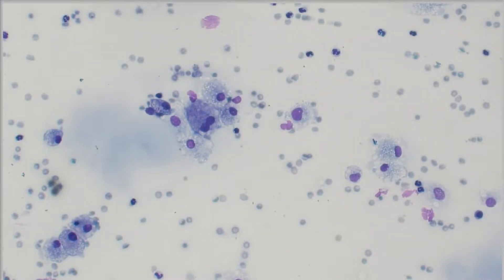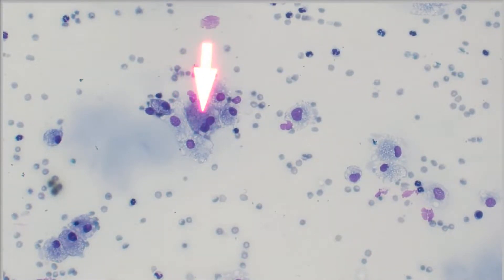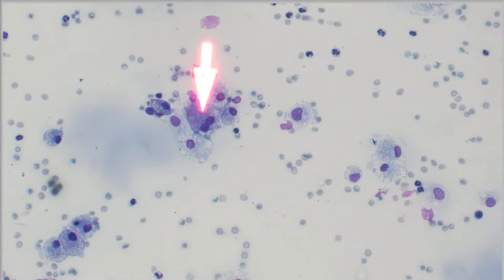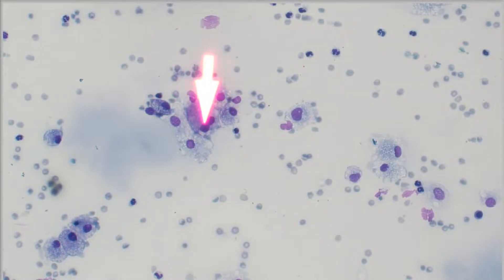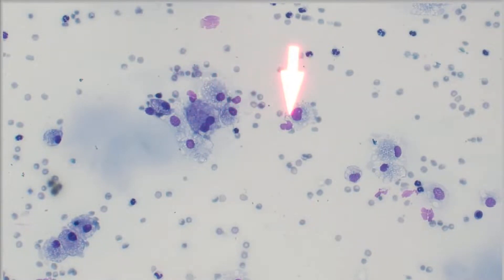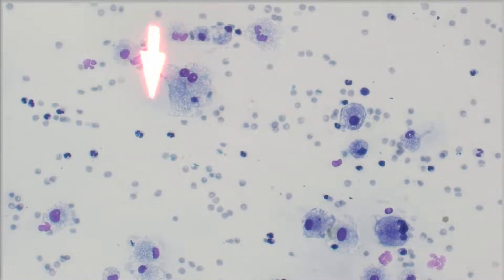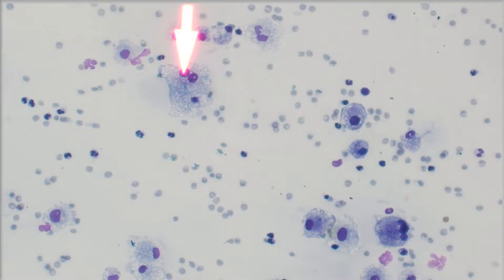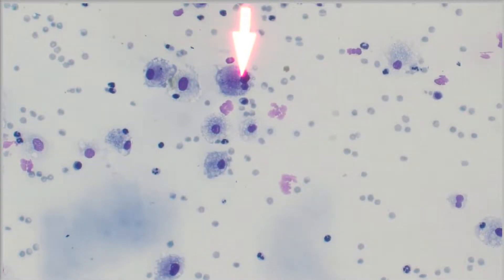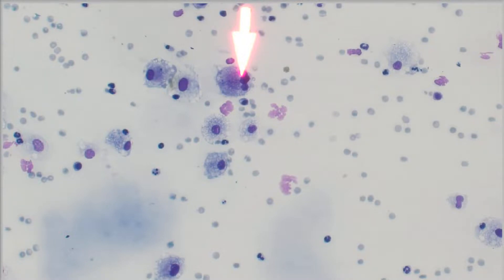A lot of these cells are these big foamy guys, which you can see have this vacuolated cytoplasm. They kind of have these rounded borders, lots of vacuolated cytoplasm. Some of them are binucleated. A lot of them just have one nucleus, but these are a type of inflammatory cell. Nice foamy cytoplasm, single to binucleated — we have one here that looks like it has three nuclei, but that's not uncommon in macrophages. So these are actually inflammatory macrophages.